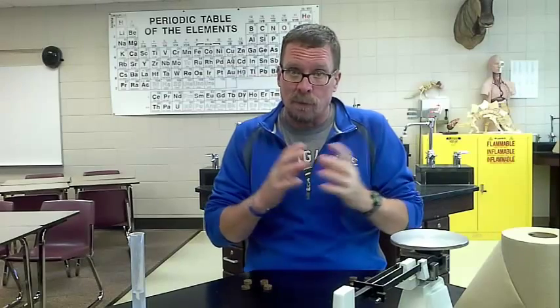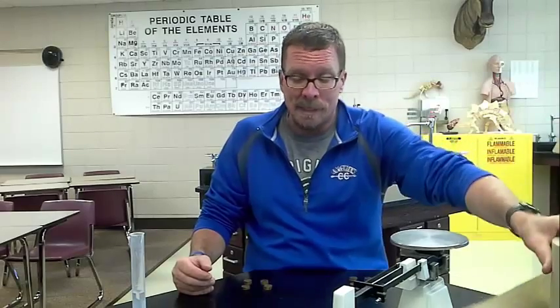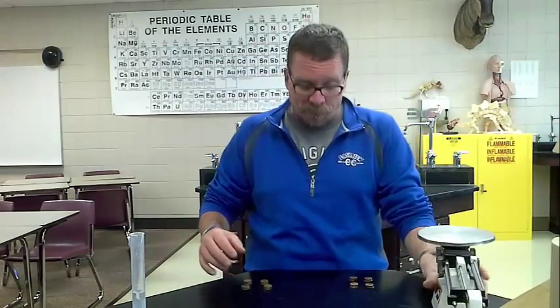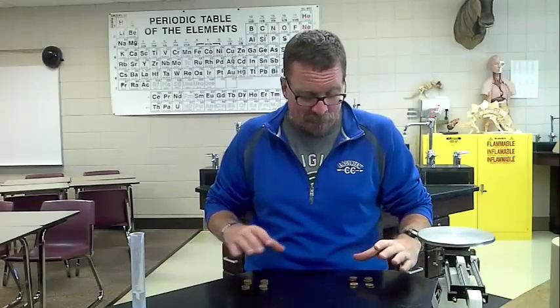We're going to do a density lab, and so you need to watch this video and take the quiz to complete part of your pre-lab assignment. It's a very simple lab that we're going to be doing in class. I've got a couple things in front of me here. You can see I have two sets of 20 pennies in stacks of 5.